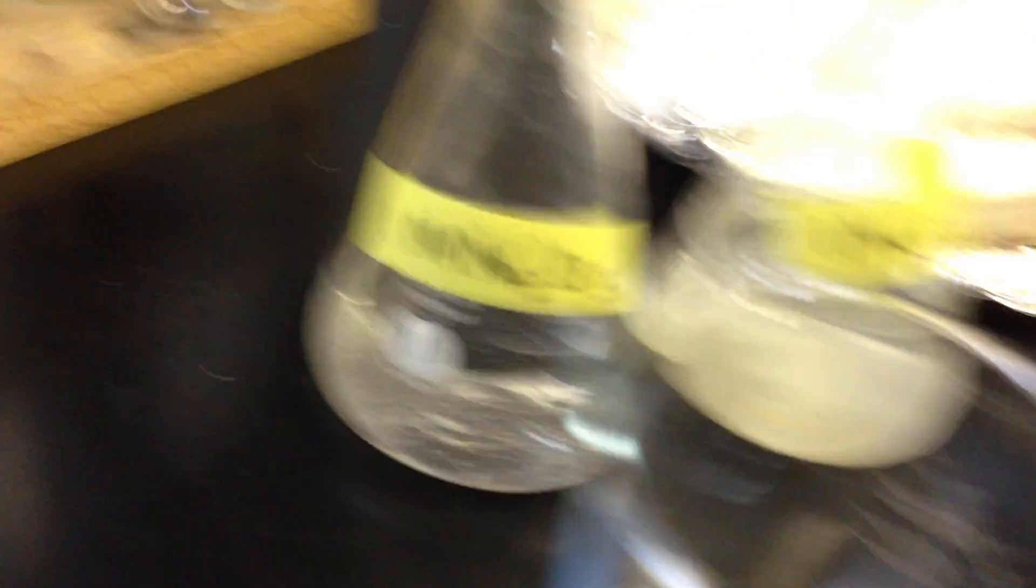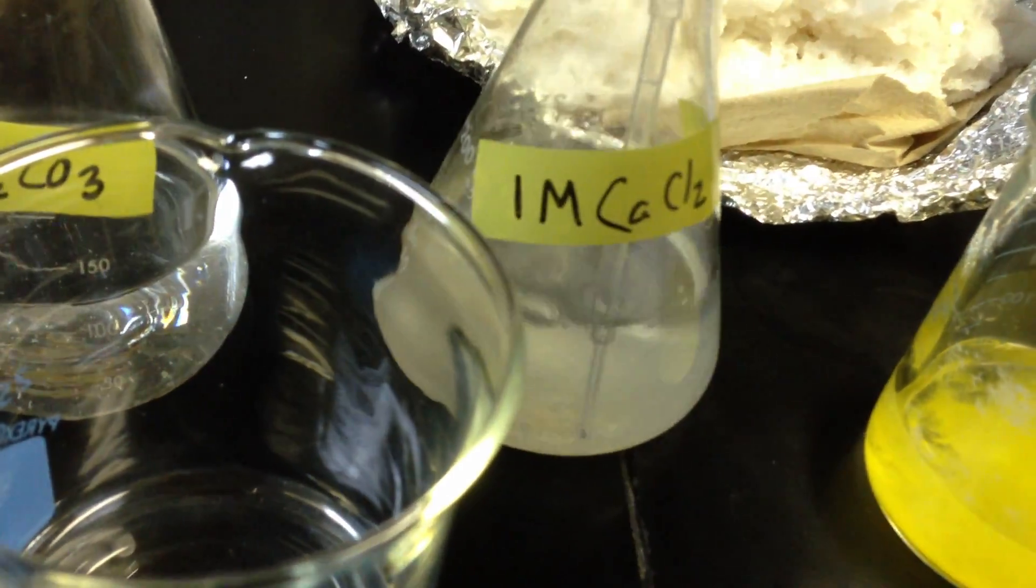So here I have some sodium carbonate that's been dissolved. It's in my beaker here. You can see that it's AQ. It dissolves very well in water, and my calcium chloride, which also is AQ. So we'll do the same thing. We'll do the side view first here, see if you guys like that better. Let's see here, put a couple drops in. And this one's not nearly as pronounced or as pretty as the other. Put a little bit more in there, and you can see it started off with a little gelatinous precipitate there.